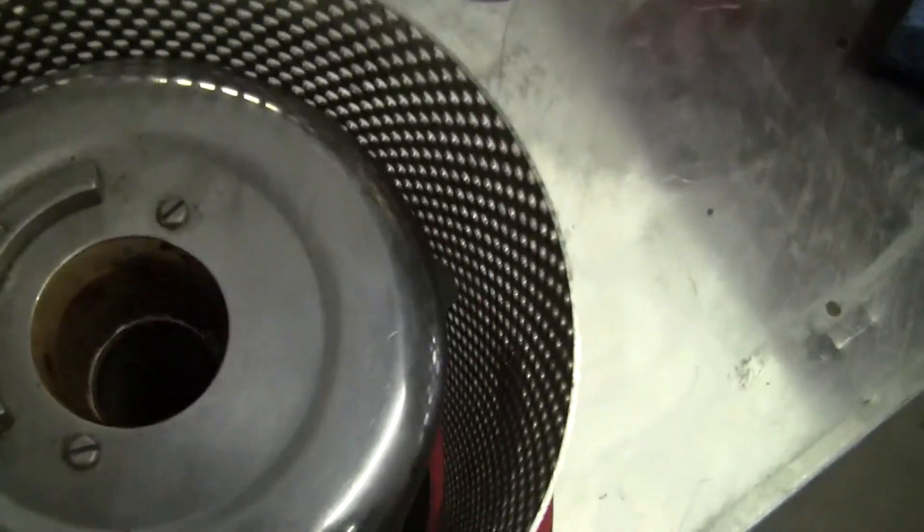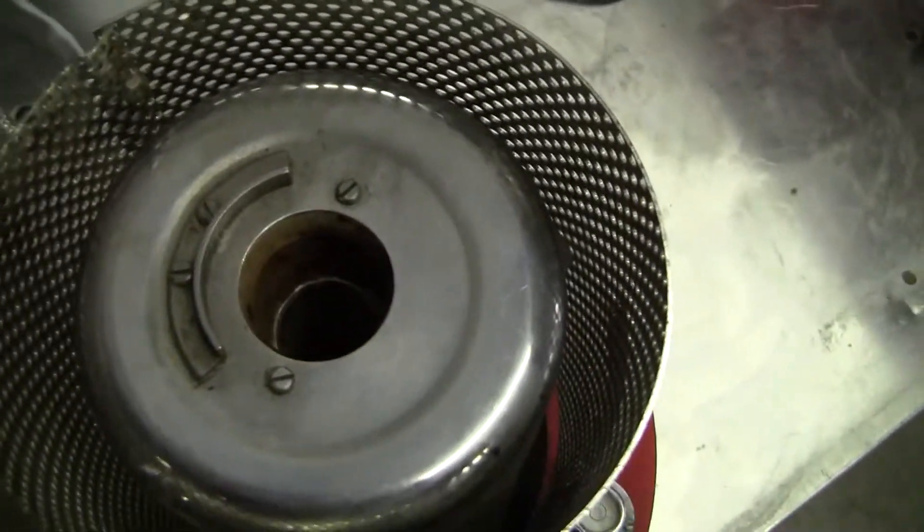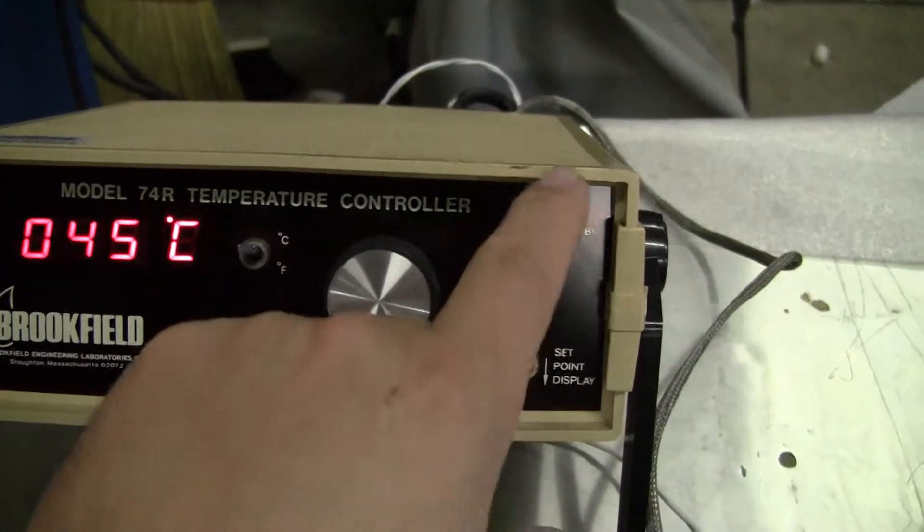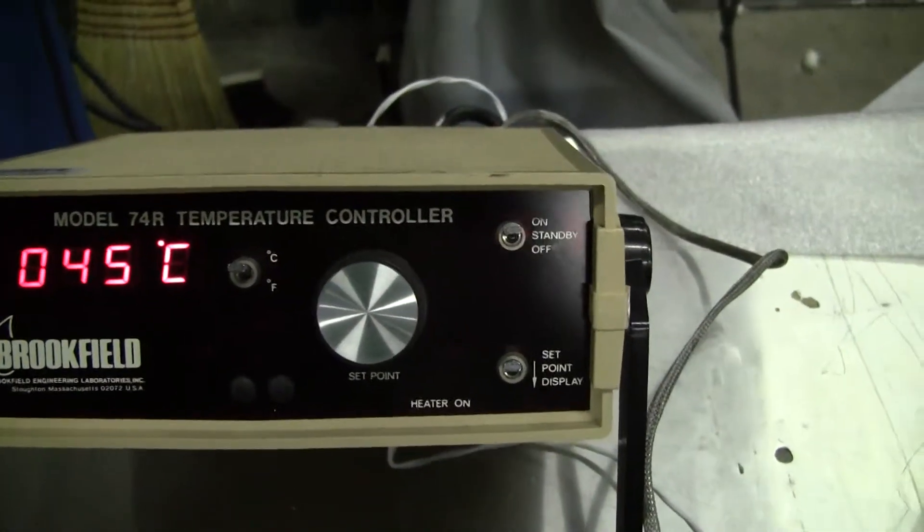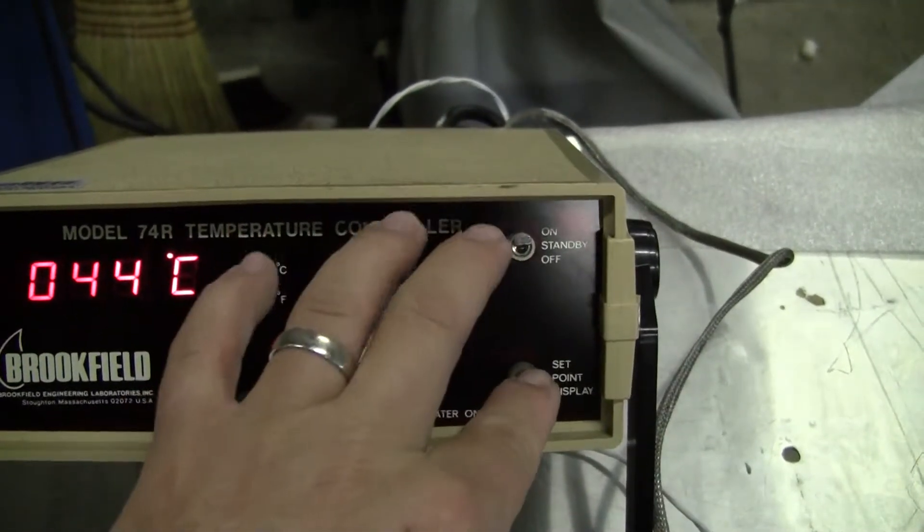Let's see if I can get you going there. What you'll notice is there's a standby off three-way switch here. Set point display is, you're going to turn that down and adjust your set point.